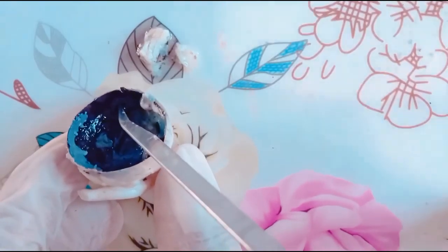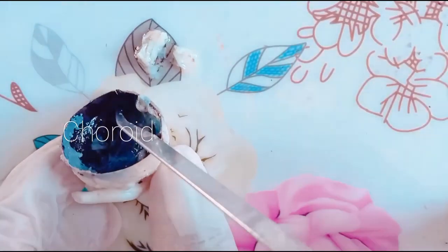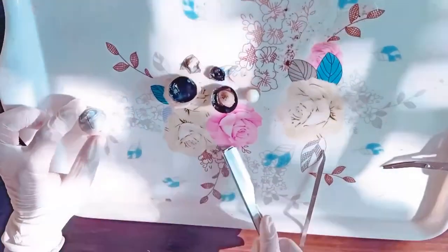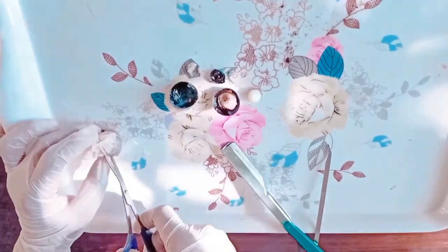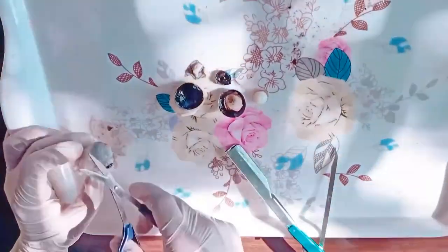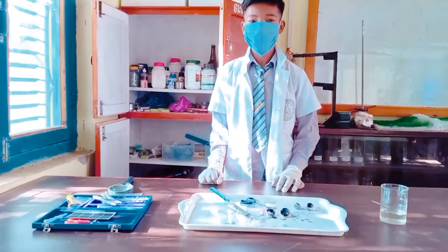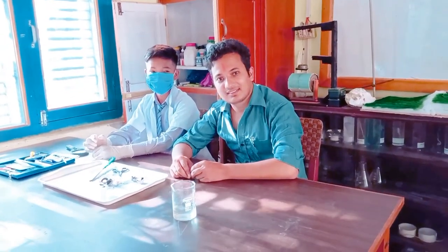This is the middle layer, dark black in color. This layer is called the choroid. This layer helps to form a clear image of the object. Thank you.